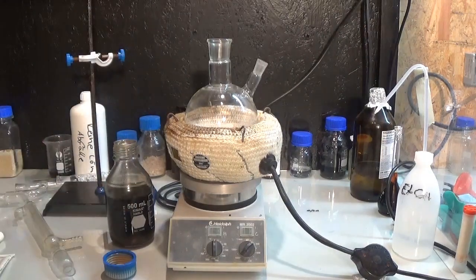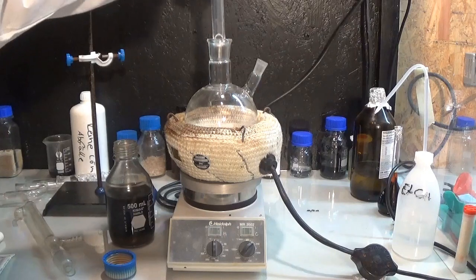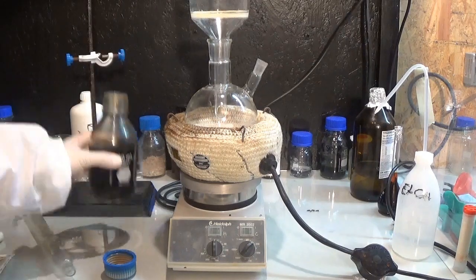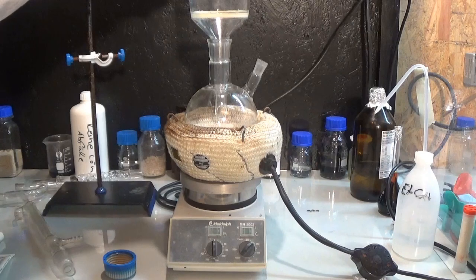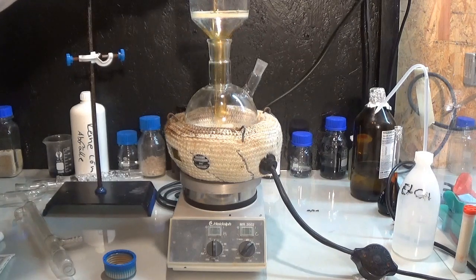The distillation we perform is similar to the process used in the petrol industry to separate the different hydrocarbons from each other. Therefore we fill the crude oil in a 1 liter 2-neck round bottom flask.